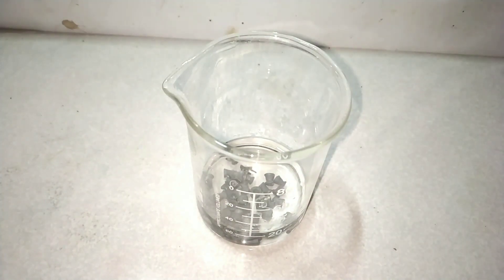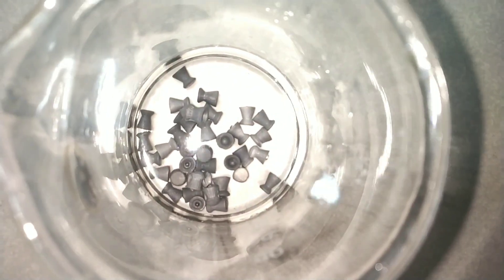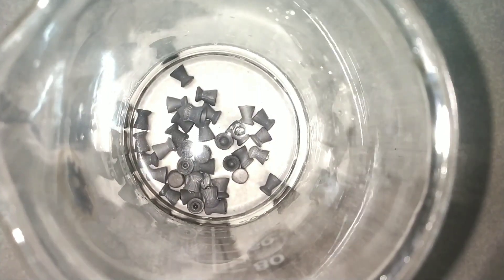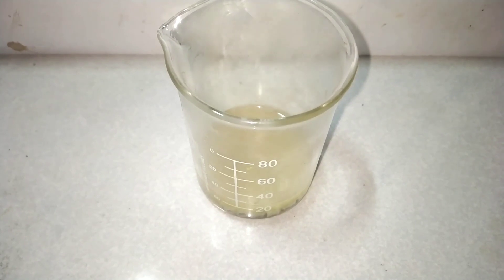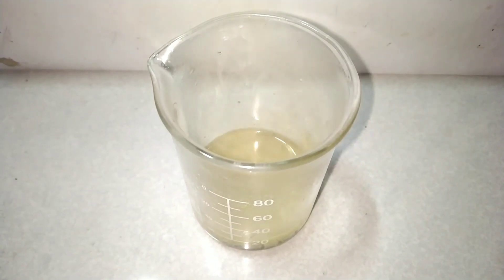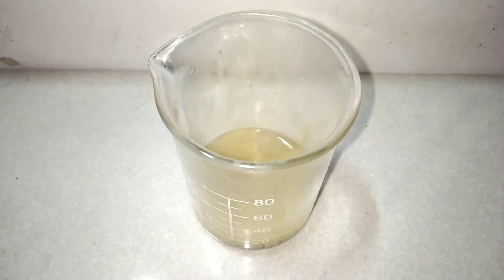You can see that actually nothing is happening now. A few bubbles here and there, probably trapped air inside the bullets — otherwise pretty much dormant. After about 2 minutes you can see some brownish discoloration and some fumes are released. The reaction is slowly getting into action.